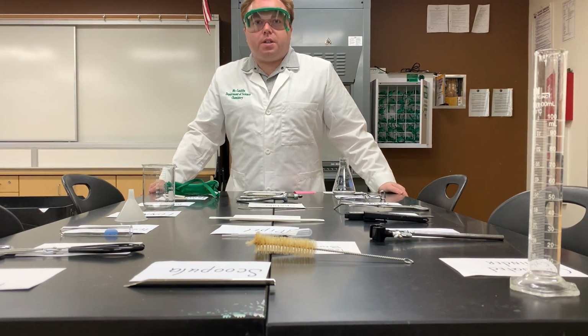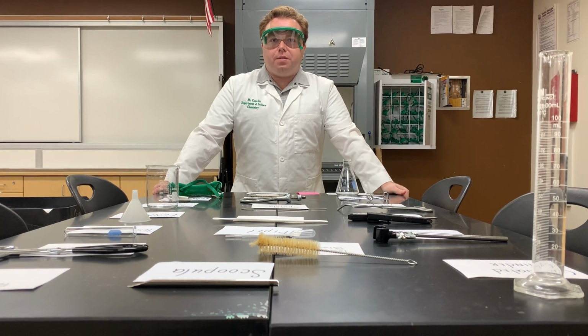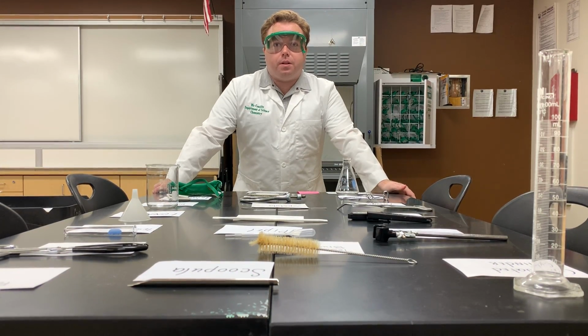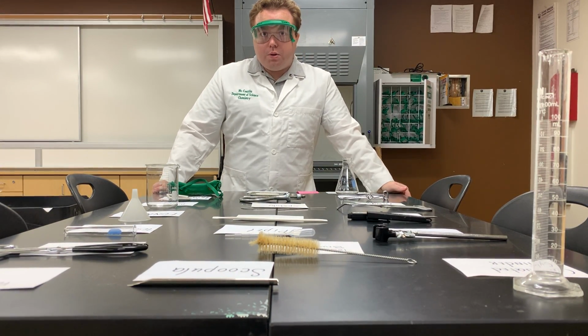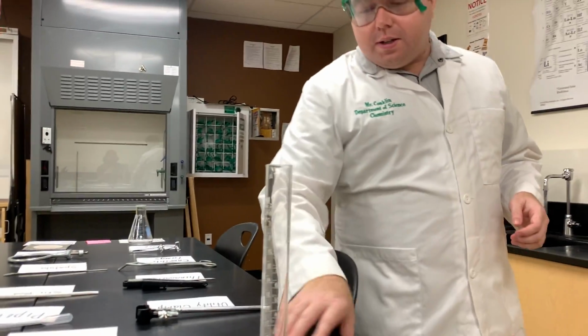All right, Orange Vista Chemistry students, welcome. I'm Mr. Conklin here, and we're going to give you a quick tour and explanation of the different types of chemistry equipment that we use here in the lab, so that you're familiar with it in case we're ever called back to school. First thing I'm going to start you off with over here is the graduated cylinder.